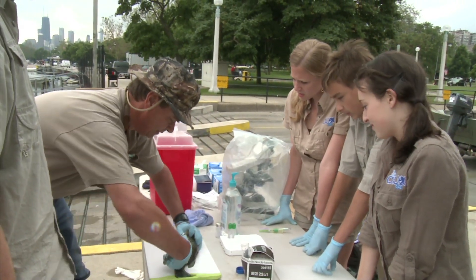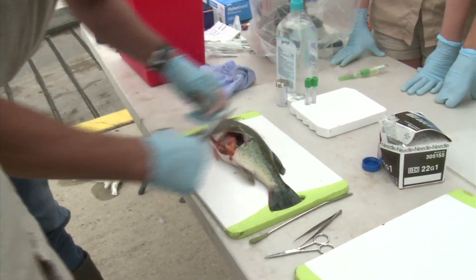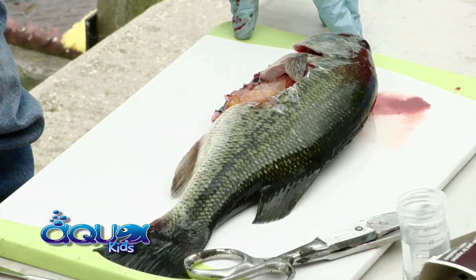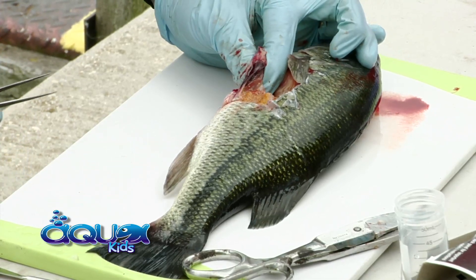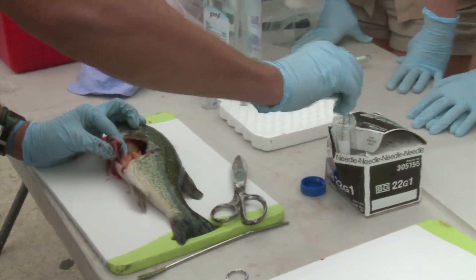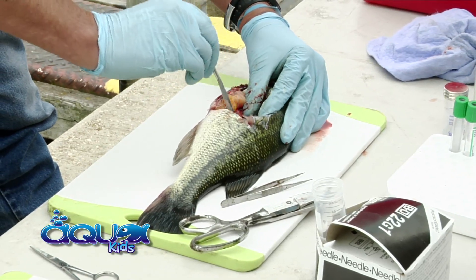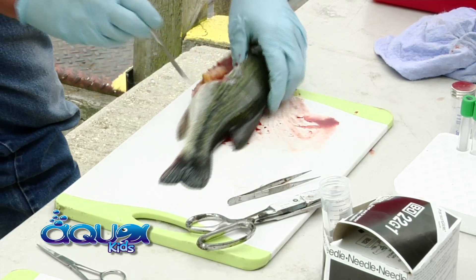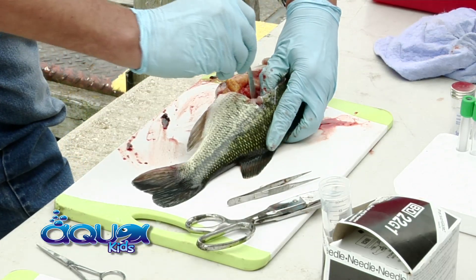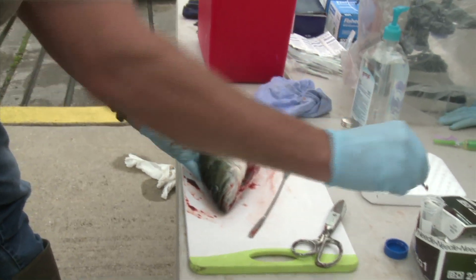Going up to the lateral line on this side and taking out the belly meat. You can see on this fish, she does have eggs. With the head to the left and belly towards us, you can see the spleen right there — that dark red organ right there. These are the eggs on a female. We're going to take a small piece of that spleen and put it in the buffer media to send in. Now we're going to go for the kidneys — they are up against the body cavity on the other side of the swim bladder. You can see a little bit of the shiny surface up here, which is the kidneys. I broke the kidney loose and I'm taking a small piece to be sent in.